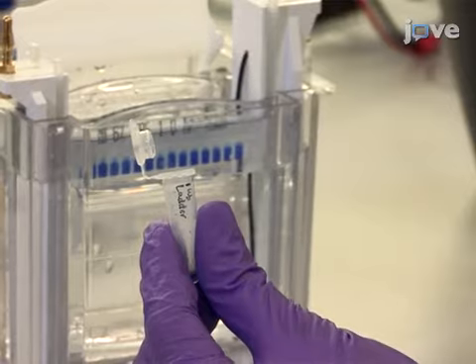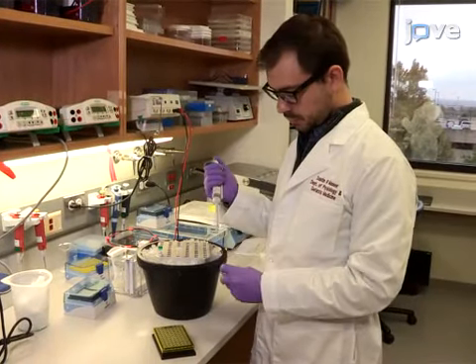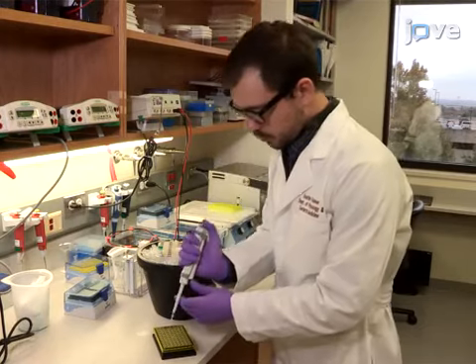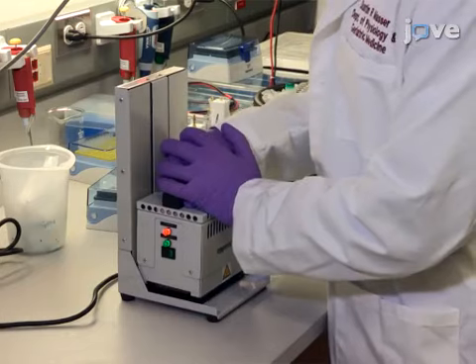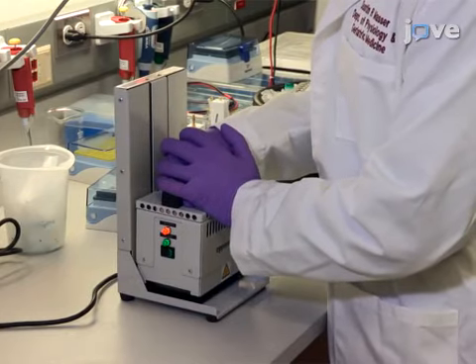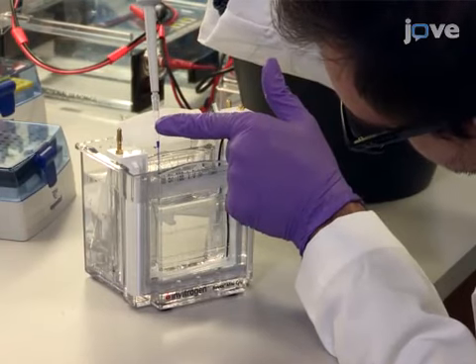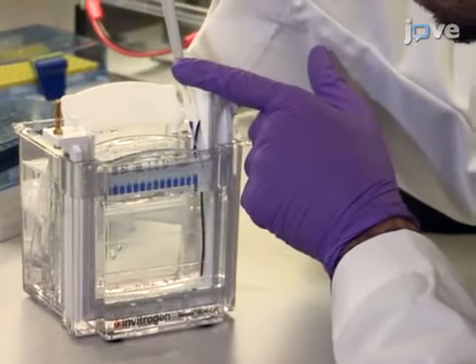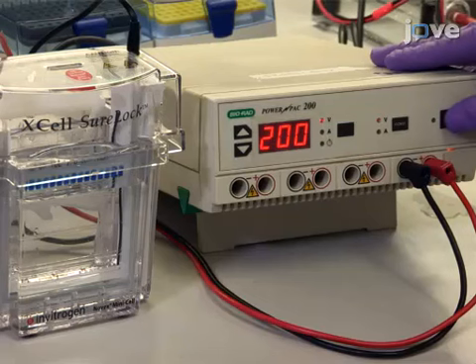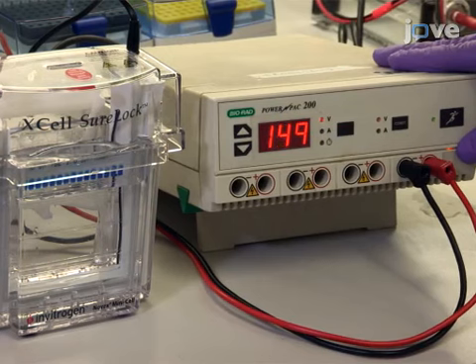After identifying the target and designing the primer, assemble the reaction for the target amplification optimization of a single amplicon, and then seal the PCR plate with heat-sealed film. To visualize the amplicons by PAGE electrophoresis, next load the appropriate wells with 30 microliters of PCR reactions or ladder, and then run the gel at 200 volts for approximately 45 minutes.